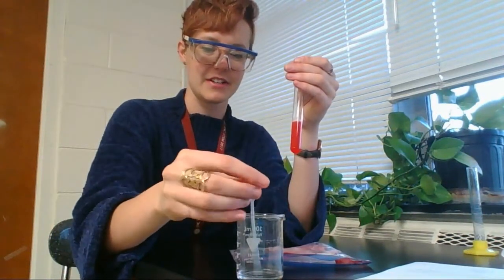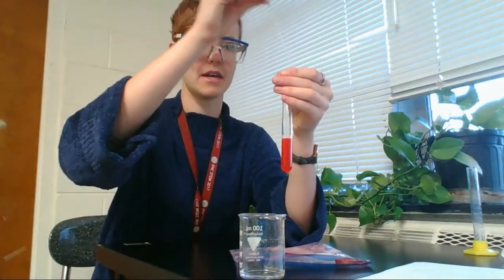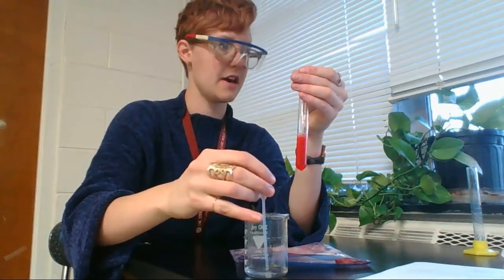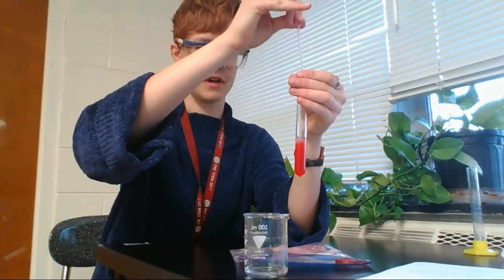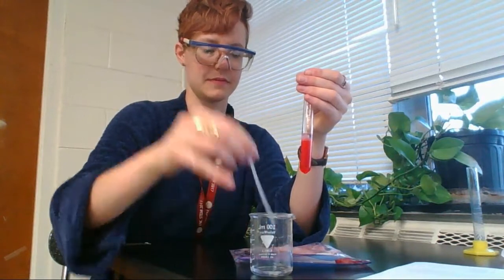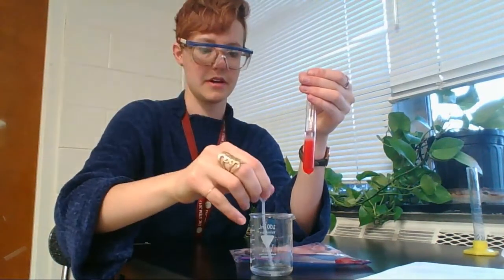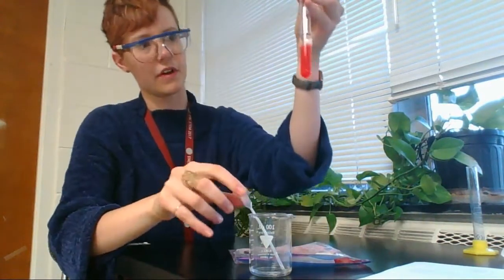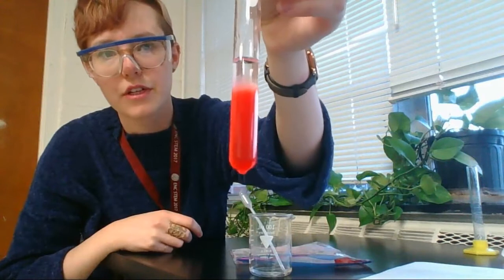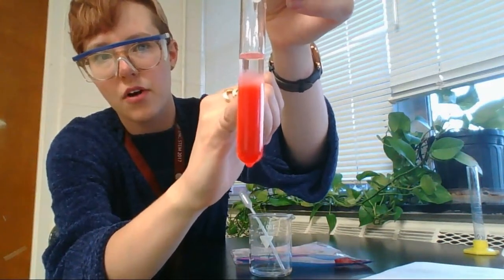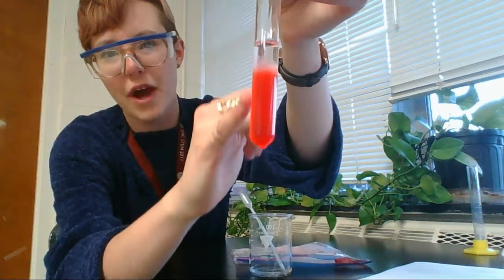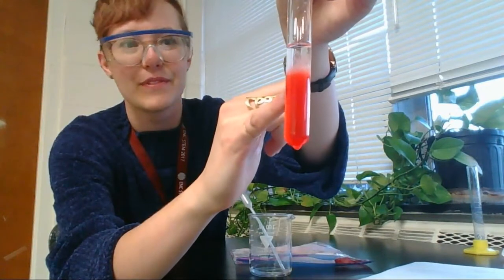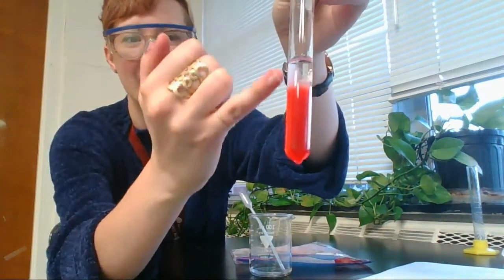If you look closely, you're going to see this clear liquid here, that's the alcohol. You're going to see our red strawberry guts at the bottom. But in between, you're going to see this kind of like, it kind of looks like snot. This like cloudy kind of mixture.